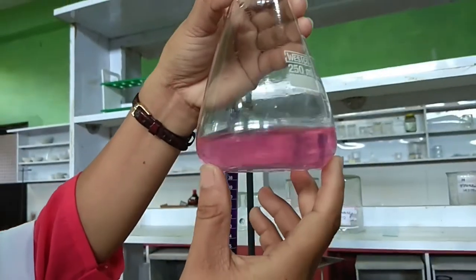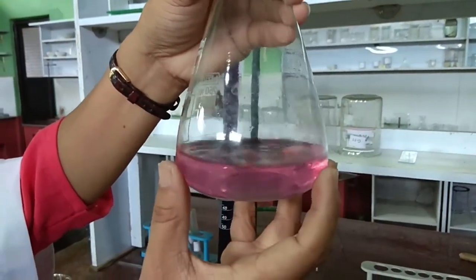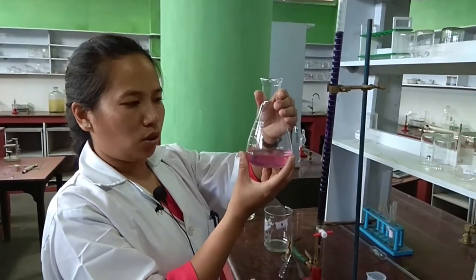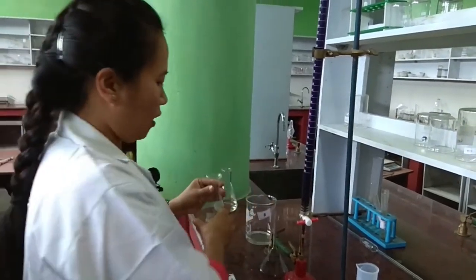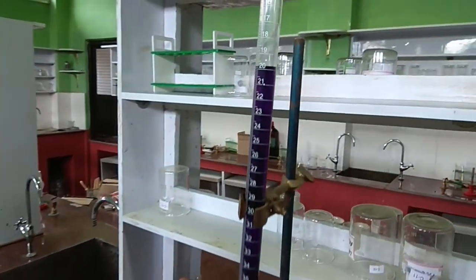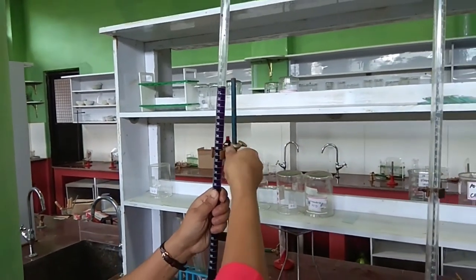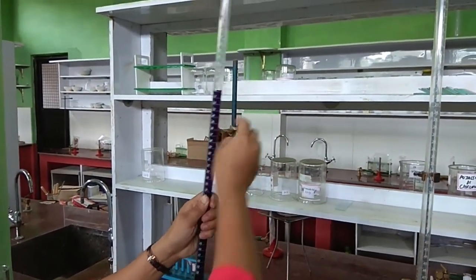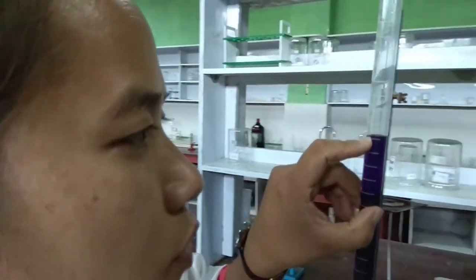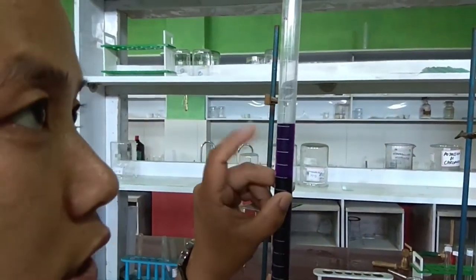The appearance of light pink color indicates the complete oxidation of hydrated ammonium iron 2 sulfate solution by KMnO4. Now record the burette reading, which is the titre value. Remove this burette from the clamp and bring it to eye level. Check the upper meniscus of the KMnO4 solution, because we cannot read the lower meniscus for a dark solution.